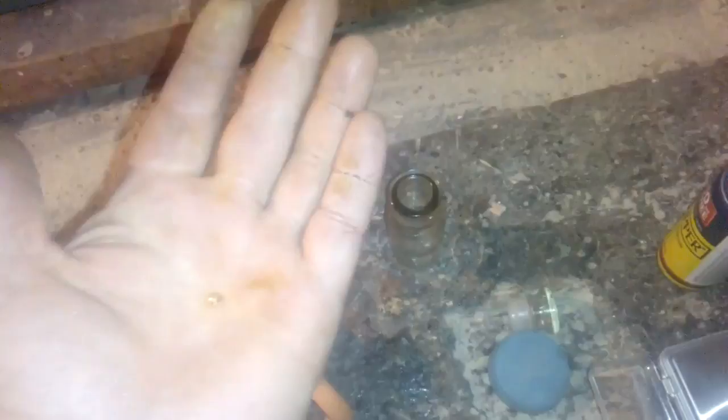Okay, so this is why you shouldn't put that pin straight into Aqua Regia, because it's a very, very slow process. So my method is priority to AP, then acid bleach or Aqua Regia, but first AP, to remove all that extra base metal. Okay, see you around, guys.